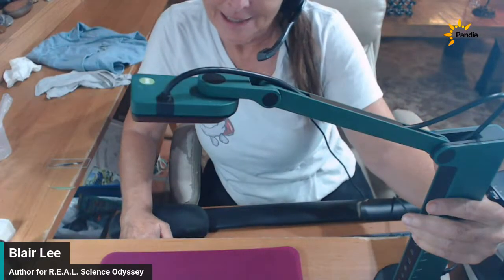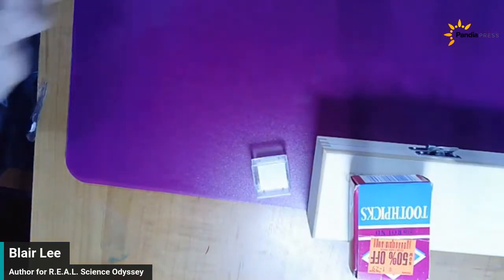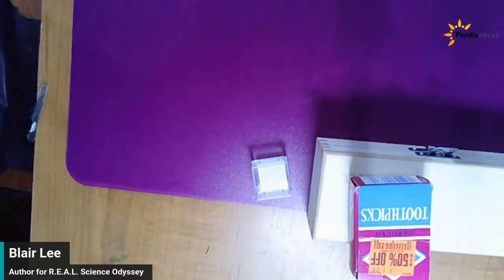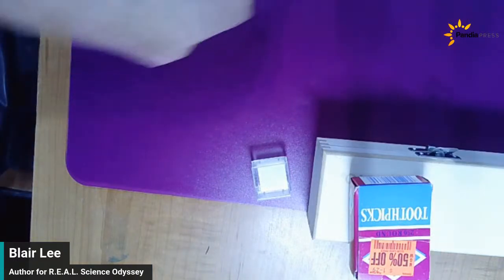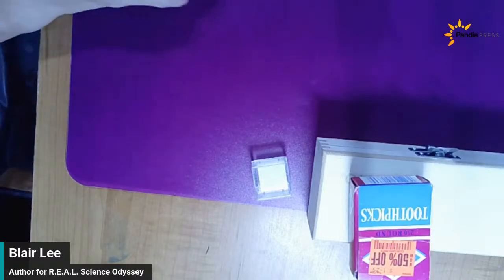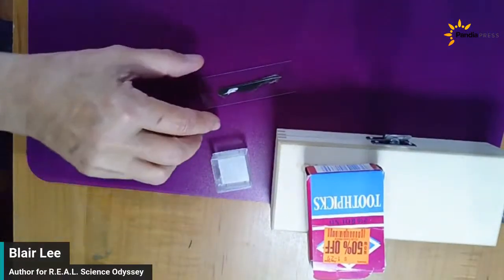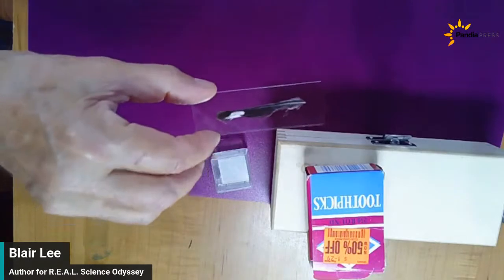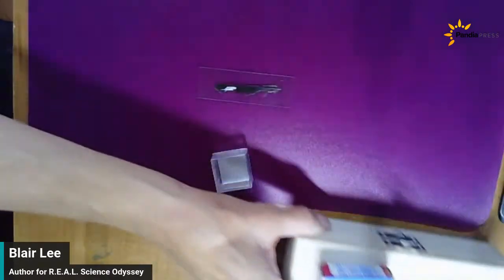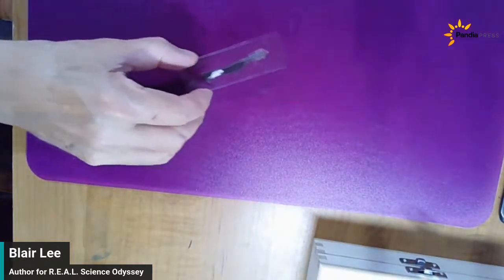The first slide is a dry mount slide — this is very simple. It's just a feather sitting on a slide. I plucked this feather out of a spider's web, and I didn't want any spider web debris on my slide. I'm going to put this on my microscope.